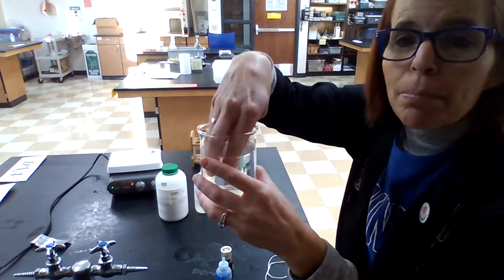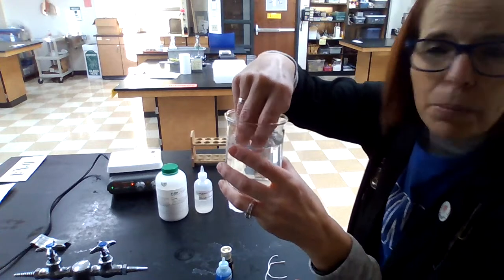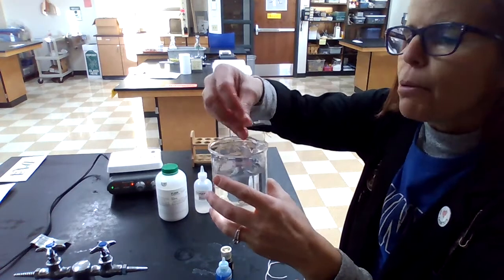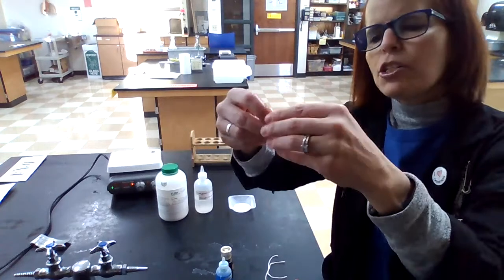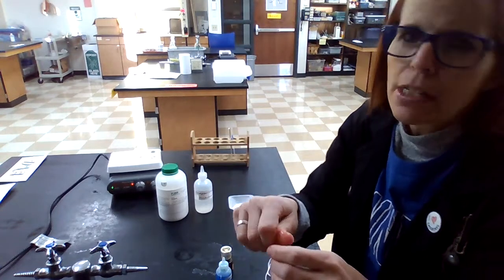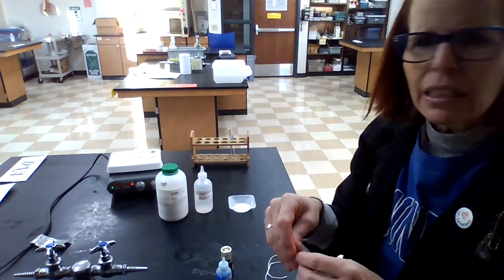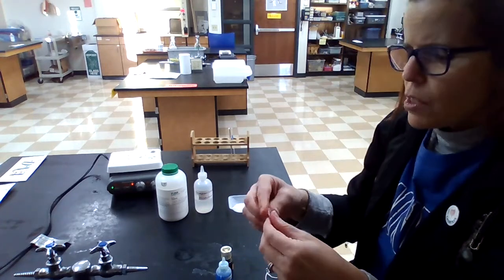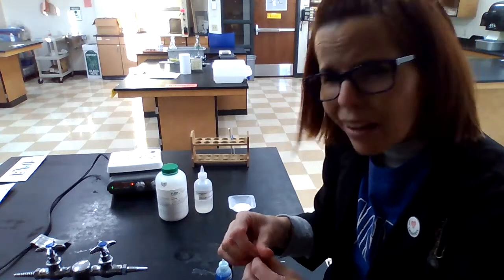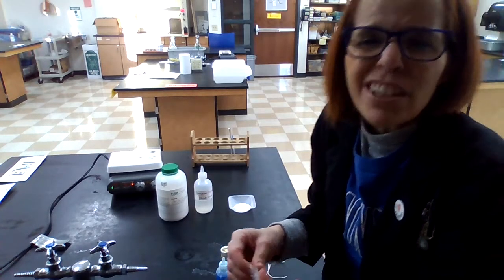For example, if I threw a basketball at a volleyball net, it wouldn't go through. But a golf ball, a ping pong ball, a marble — those things could pass through. So we're going to use a semi-permeable membrane today to try to determine which is smaller: sugar or starch. Scientists have figured out how to tell even though they can't see things.